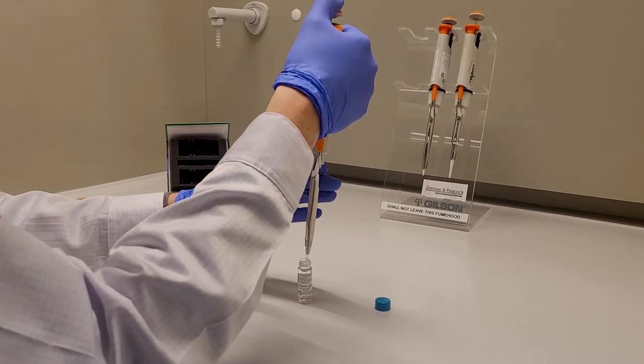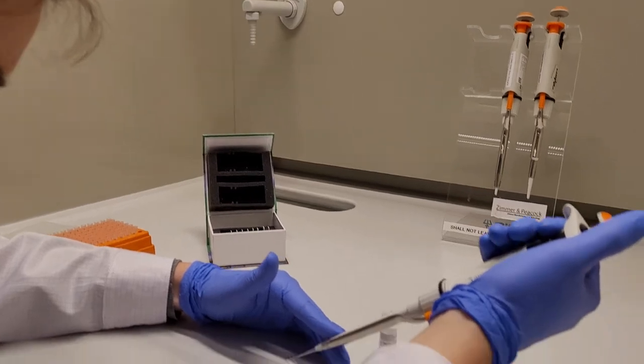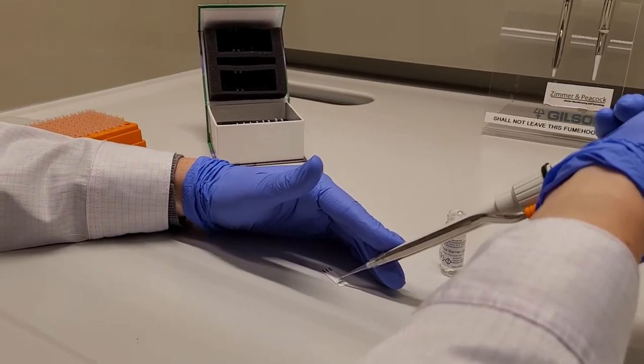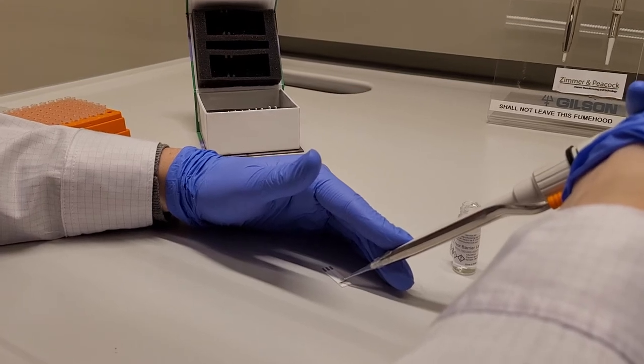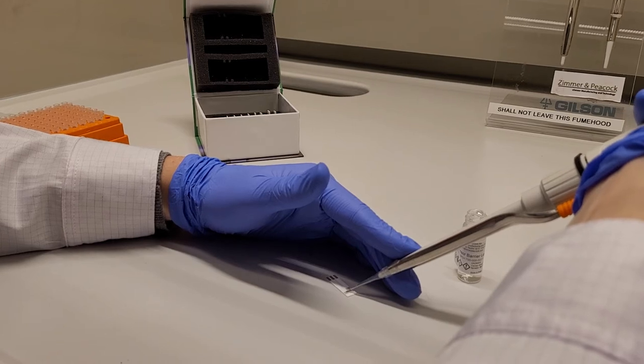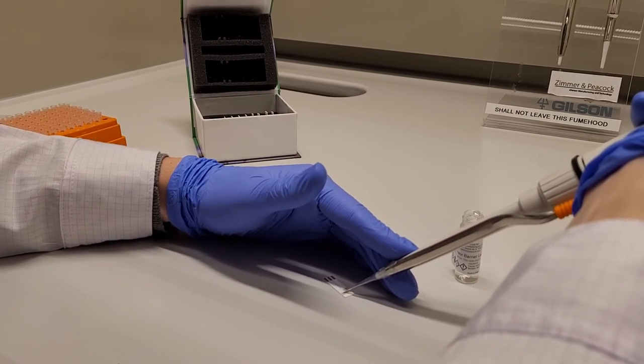Then pipette up the solution and be sure not to be harsh with the working electrode but just gently touch it if you have to touch it to get the solution up and then apply it like that.